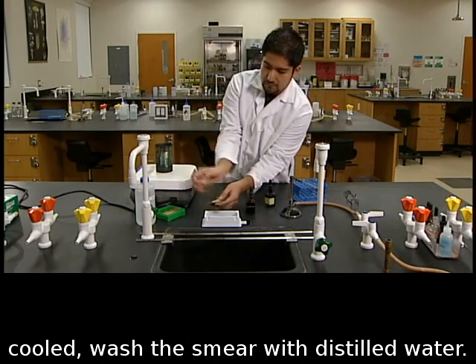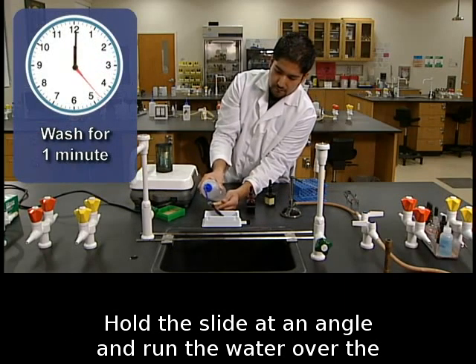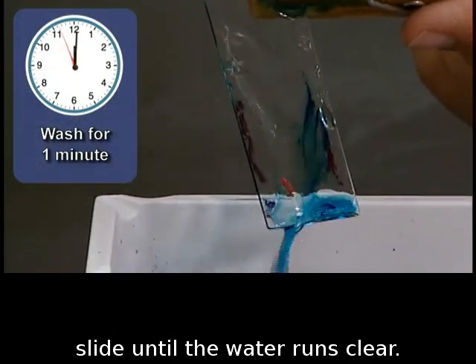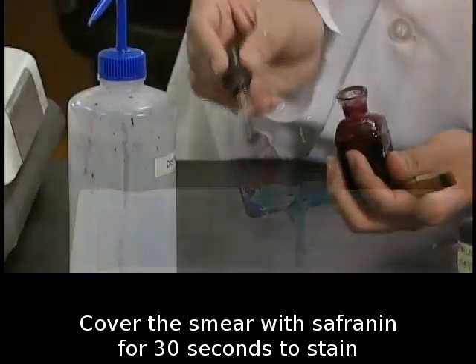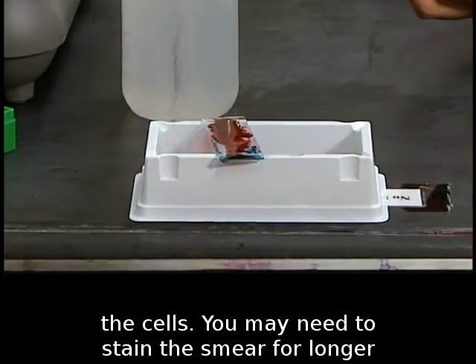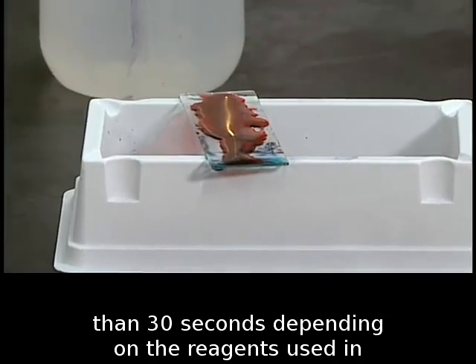After the slide has cooled, wash the smear with distilled water. Hold the slide at an angle and run the water over the slide until the water runs clear. Cover the smear with safranin for 30 seconds to stain the cells. You may need to stain the smear for longer than 30 seconds, depending on the reagents used in your lab.